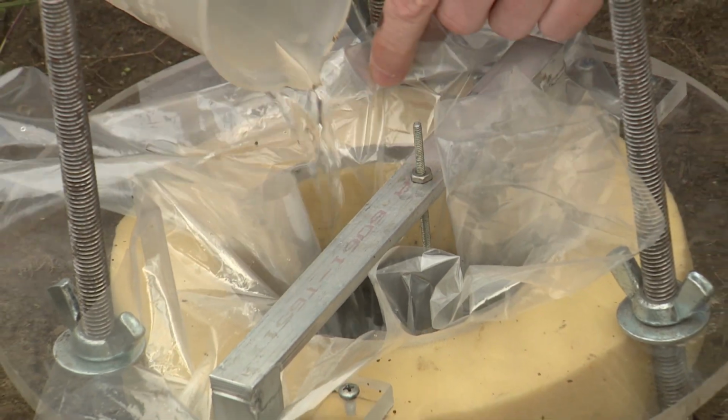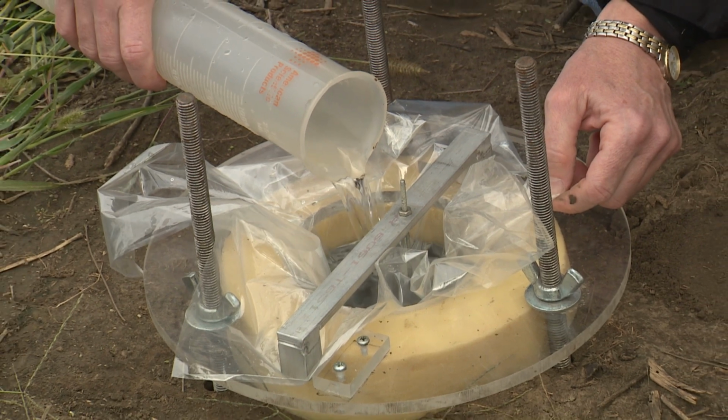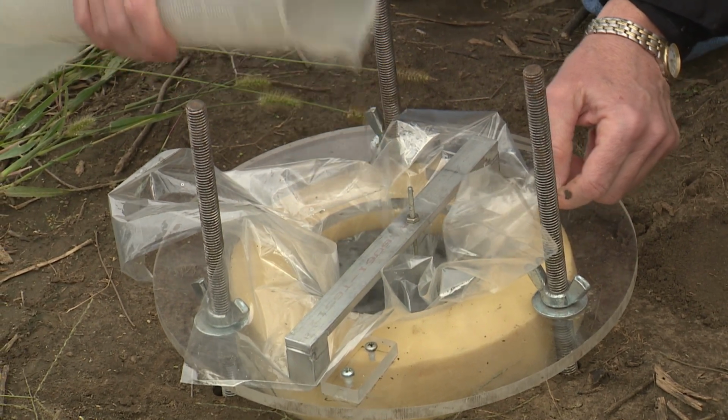Okay, then you're going to need more water this time. So you may want to use the 1,000 milliliters, but I like to use the 500 mils. And if I have to, I'll fill it twice. So I'll take a 500 mils and I'll fill the cavity. Usually it'll take the whole 500. Then I'll fill up the graduated cylinder again with another 500. And so then you'll add more right to the tip of the hook gauge like you did before.